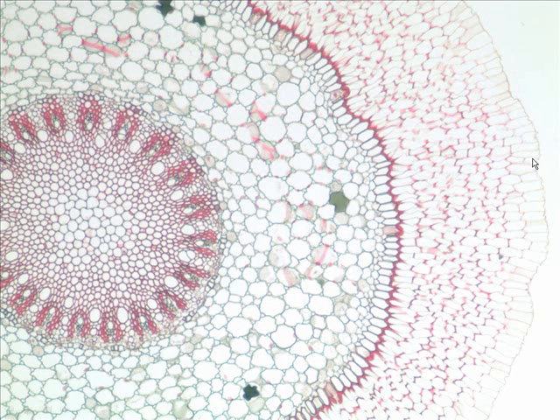Let's look at the orchid slide. So we have an epidermis out here. There's this soft velamen, and then there's the exodermis. I'm not going to ask you any of those. Let's move on. What do we call this region? Cortex. Oh yeah, the cortex. What kind of cells are these? What kind of tissue is it? What's the name of the tissue? Parenchyma.